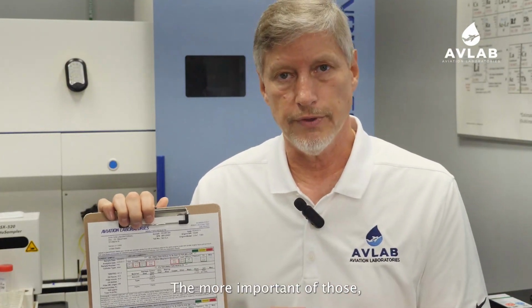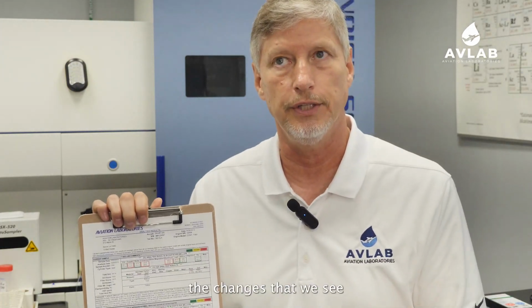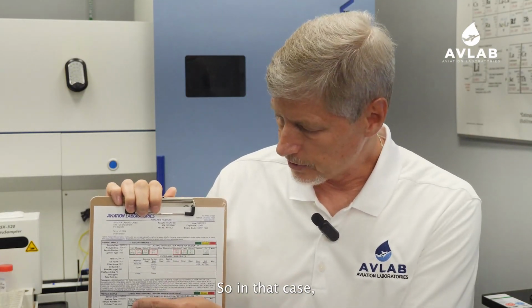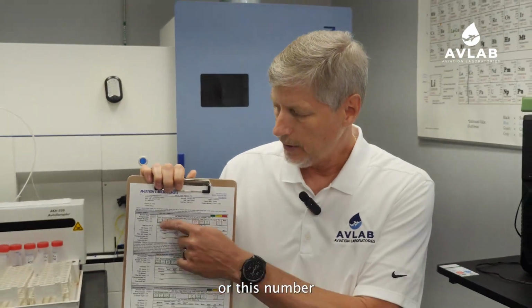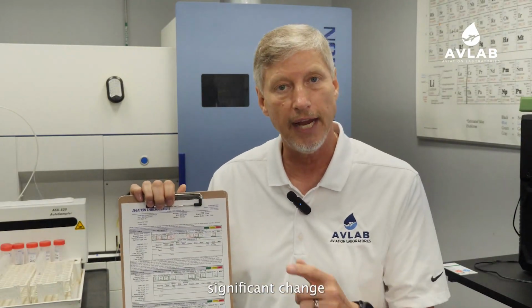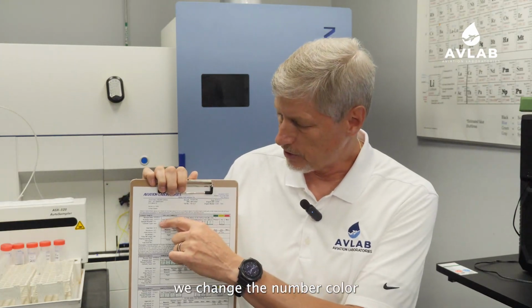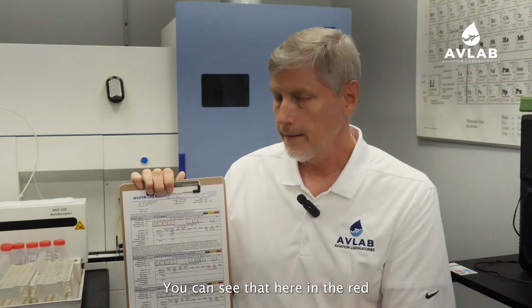The more important of those, though, is the trend of what's actually happening, the changes that we see from sample to sample of your oil analysis. In that case, we compare this number to the latest sample, and if there's a significant change from one oil sample to the next, we change the number color to red. You can see that here in the red. We call that trend statistics.